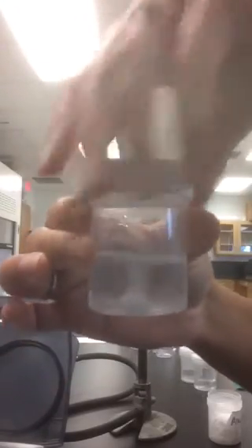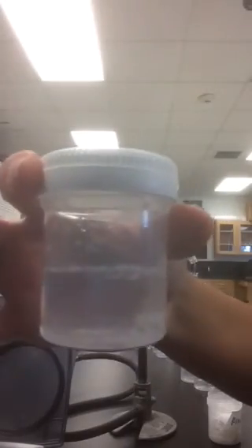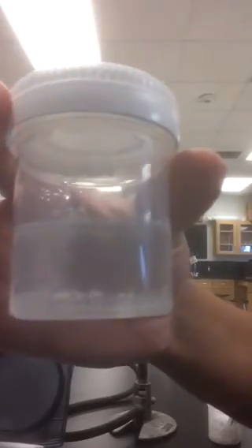Now we're going to place the Alka-Seltzer tablet inside. Note that we're definitely getting a gas produced. Because of pressure buildup, we're going to quickly take the mass again. Please record 43.0 grams and calculate your mass difference.